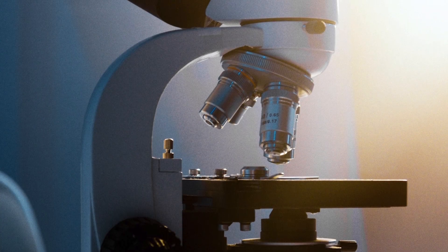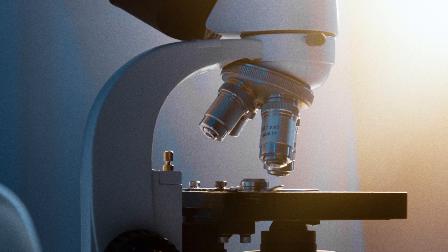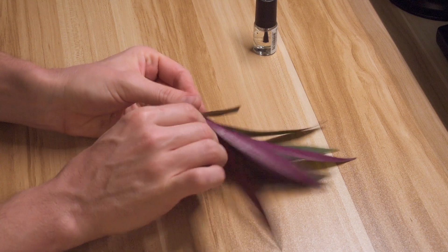There's an easy way to observe stomata, and they look really cool under the microscope. We'll have a look at the stomata of this leaf.